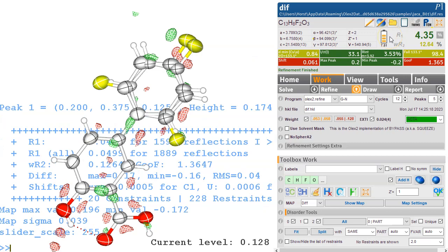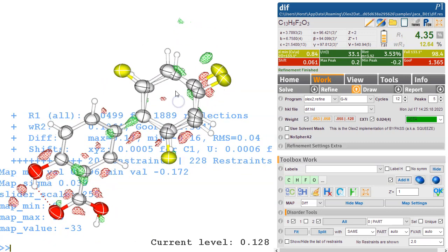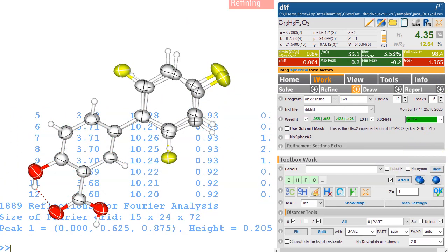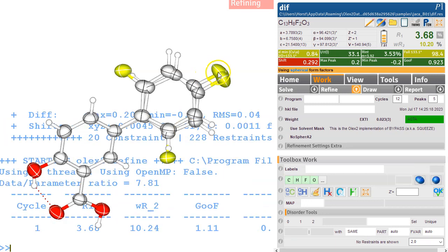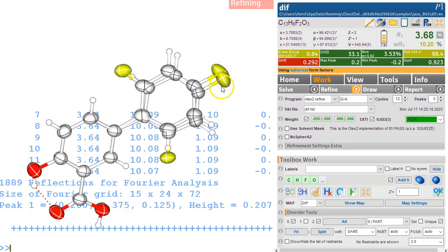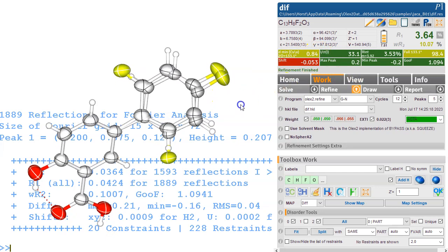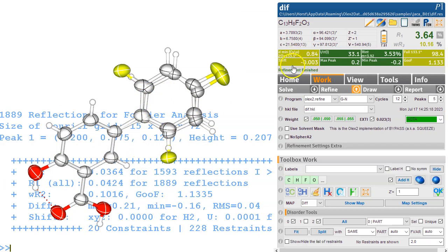The R factor is quite a lot higher than it was before. Now I suspect, why is that? Is it higher? Am I not seeing this right? Let's go back in. Oh no, it's coming down again. So the R factor is coming down again. Right. So this is an alternative way to model that. I'm not entirely sure whether I would advocate this. It's a little bit over engineered in a way, and it's also not settling, but it is settling eventually.